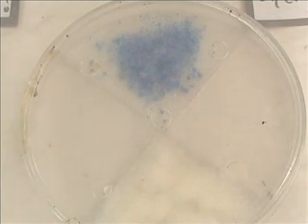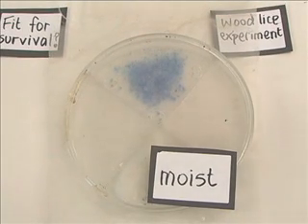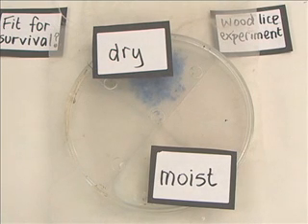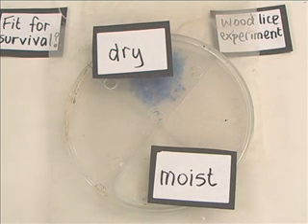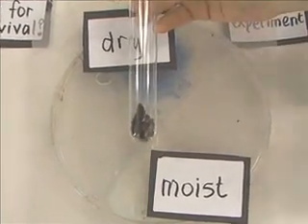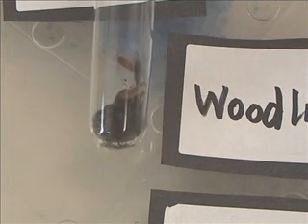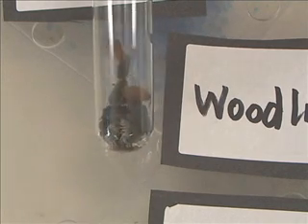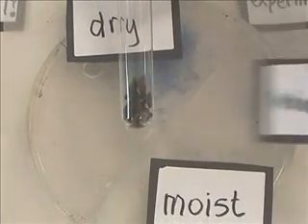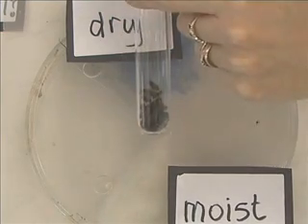So now we have an area which is moist and an area which is dry. Here are the woodlice — they've been collected from some leaf litter ready for the experiment. Now we're going to add them to the choice chamber and watch and see which part of the choice chamber they prefer to stay in.